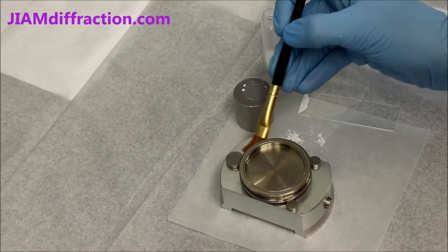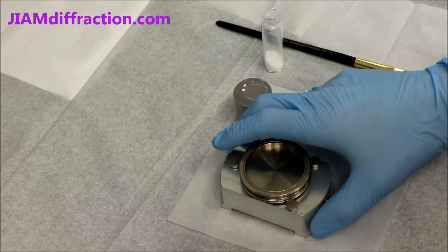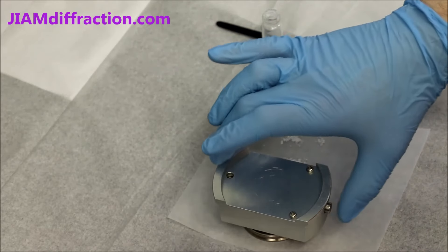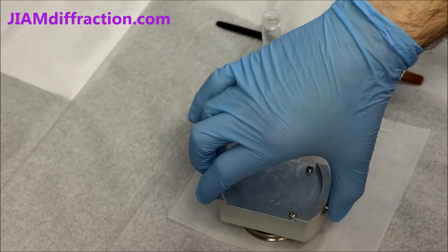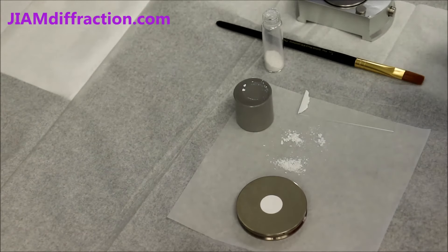Actually let me brush off a little bit that fell on the side here. I'll take the whole block, flip it, and then press this button and lift straight up. And there you have a nice smooth surface level with the plate.